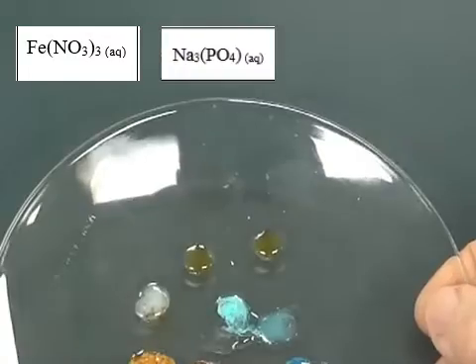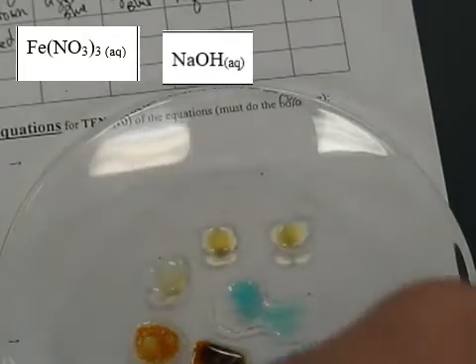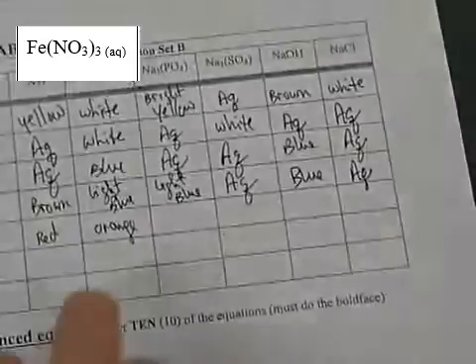Sodium phosphate, now you have a white precipitate. Sodium sulfate does not react. And sodium hydroxide reaction, a red. It's kind of a deep orange there. So let's go through these.